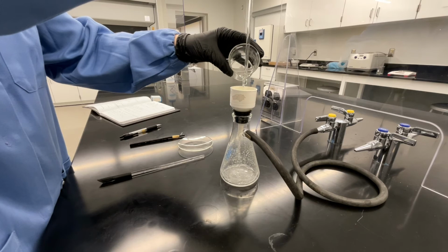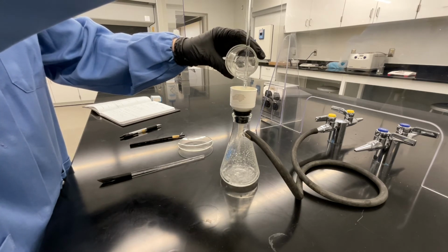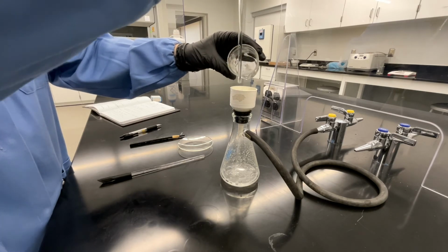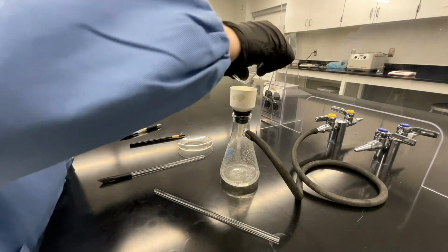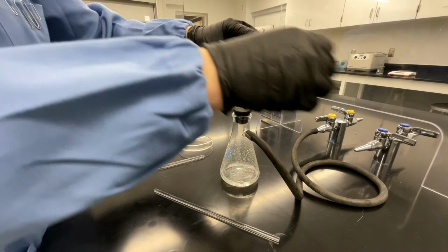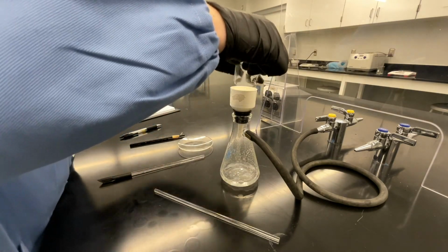As before, use a stirring rod to guide your pouring. As you're pouring, be careful not to pour the stir bar out. Try and leave that and the solid behind in your beaker. Once you've got all of the solution out, you can put your finger in front of the mouth of the beaker and carefully collect your stir bar from the beaker.